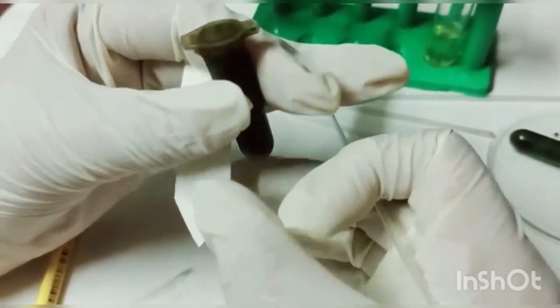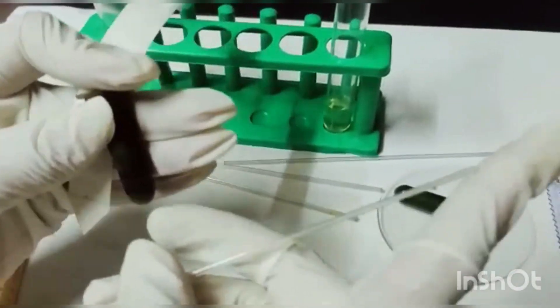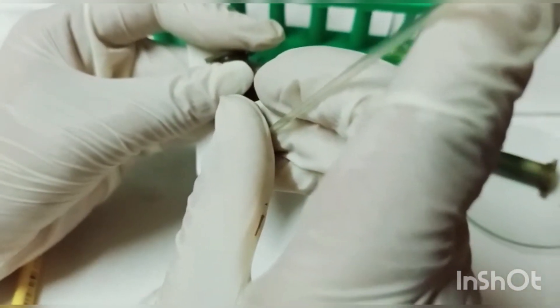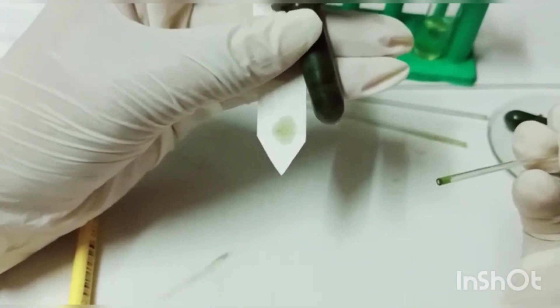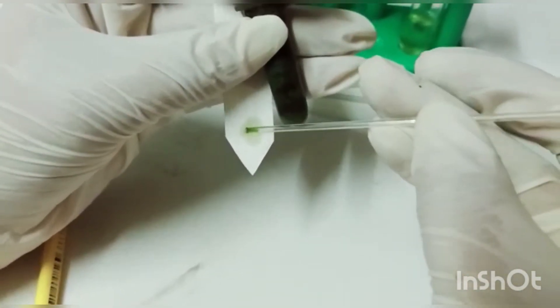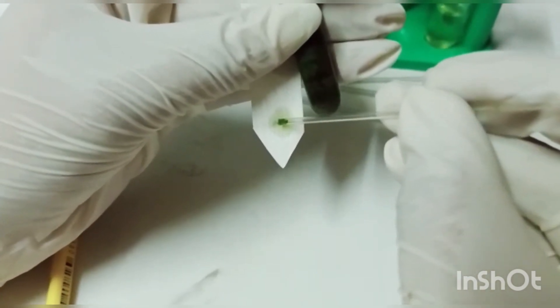For loading you need a capillary tube. This capillary tube will help to upload your extract onto the loading spot. You will hold your strip and dip the capillary tube into the extract and touch it to the marked point. You need to repeat this loading process 10 to 20 times so that maximum extract is concentrated at that spot. Do not move the capillary tube around — just point it at the pencil mark and load the extract repeatedly.